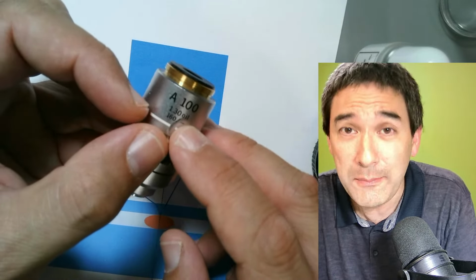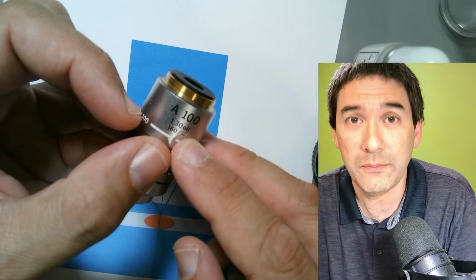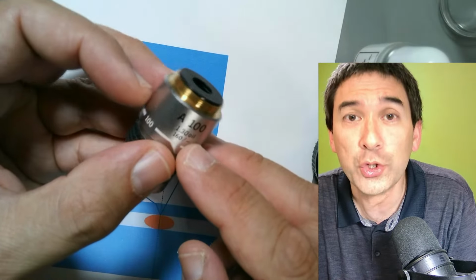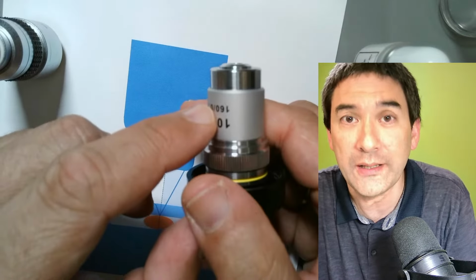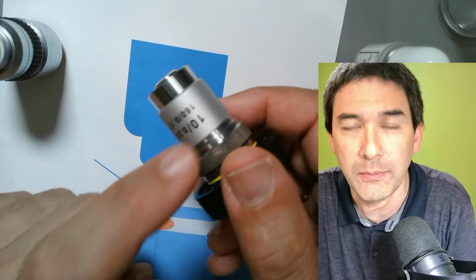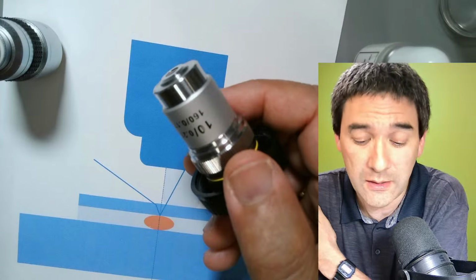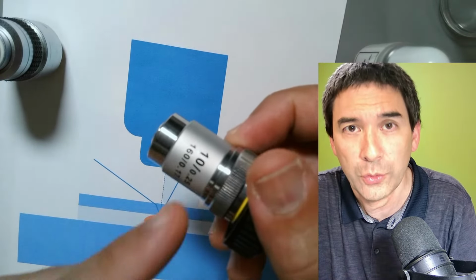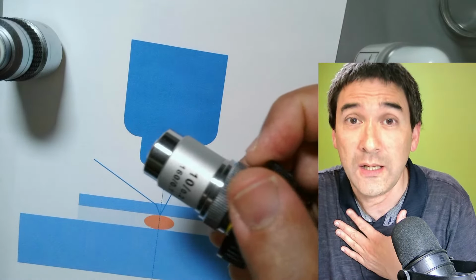It's so important. Why am I saying this? Because I received emails from beginners who said, well, I have a problem seeing the specimen, so should I now use immersion oil also on the other objectives? Seriously, if you do that, you end up destroying your objective. So you have to be really careful that you're not using oil on non-oil objectives, and this can happen very easily. It also happened to me.